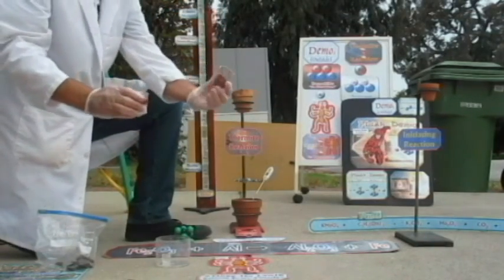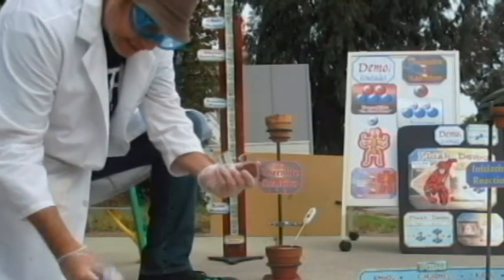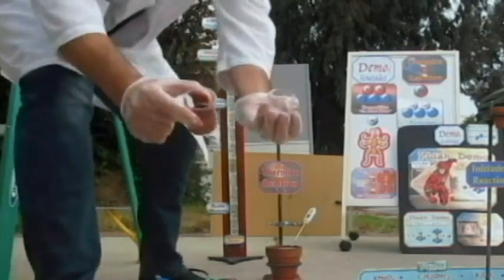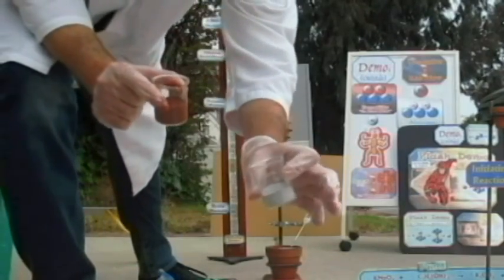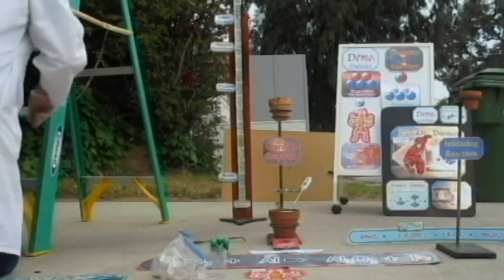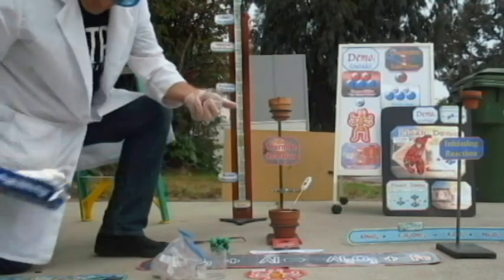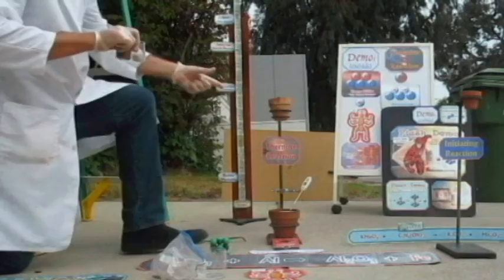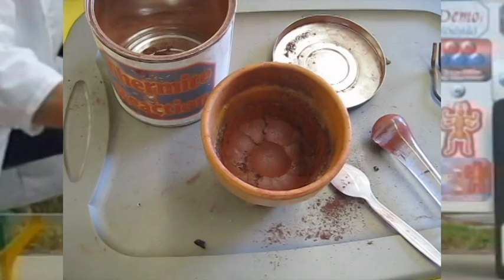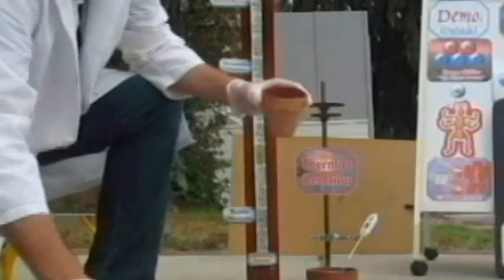After the initiating reaction, we're going to react these two chemicals. We're going to react basically what amounts to rust. It's the same thing as these little pieces of rust I found off of a little bench. It's hematite. Hematite is rust, and then this one is aluminum powder, which is the same thing that is in aluminum foil, which I have right back here. It's the same exact thing as aluminum foil, just in powdered form. And then I've mixed them together, and notice that you don't even see the aluminum anymore. All you really see is the hematite because it overpowers the aluminum, it coats it.